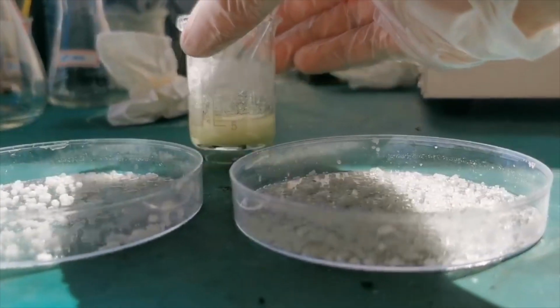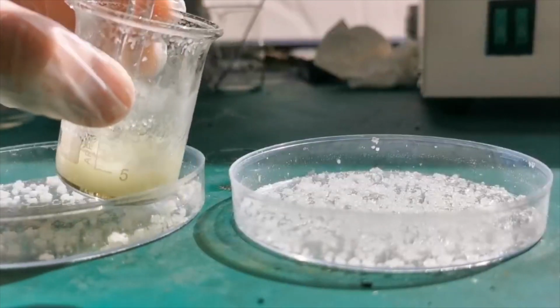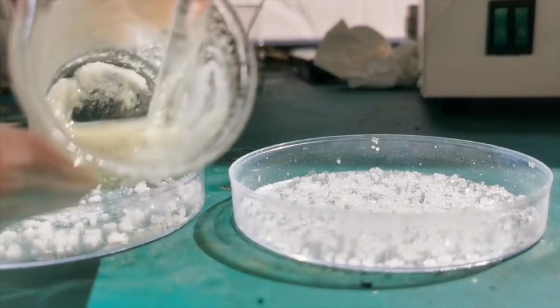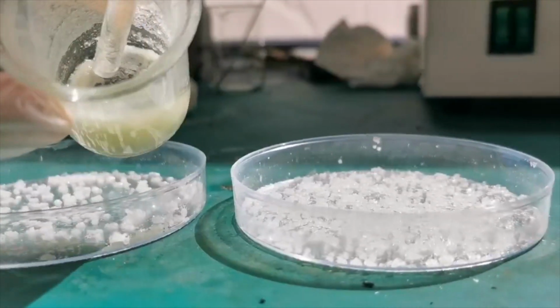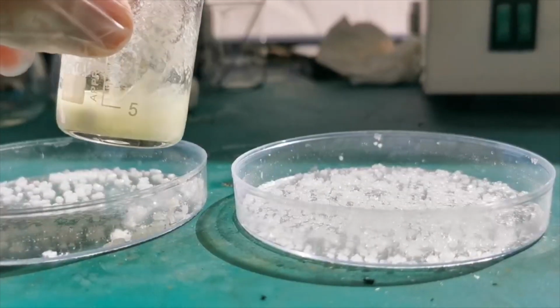When the solution cools to room temperature, a large amount of crystals crashed out. I didn't want this to happen at all, since this makes it nearly impossible to separate the crystals and the mother liquor. After trying to separate the crystals out, I gave up and discarded it.